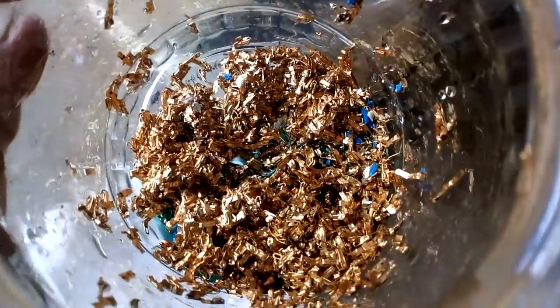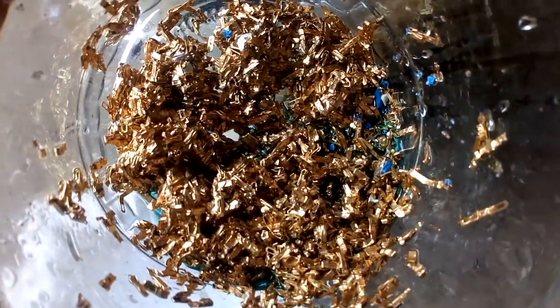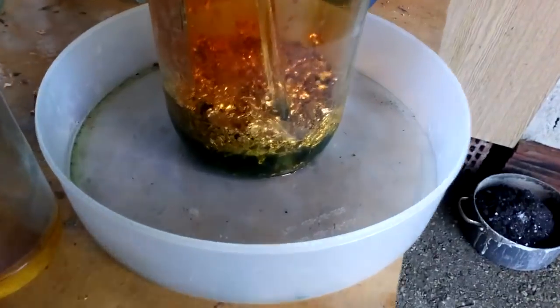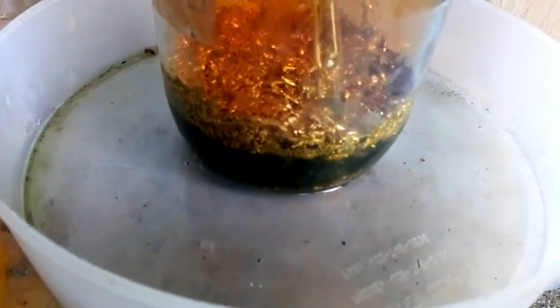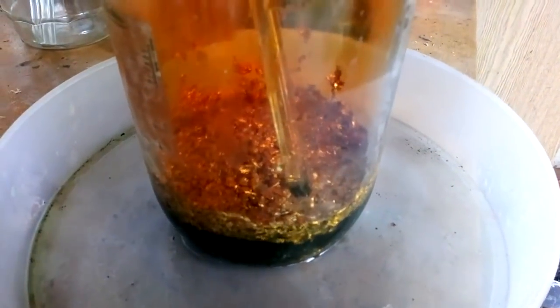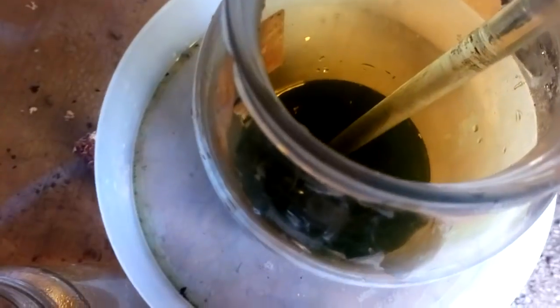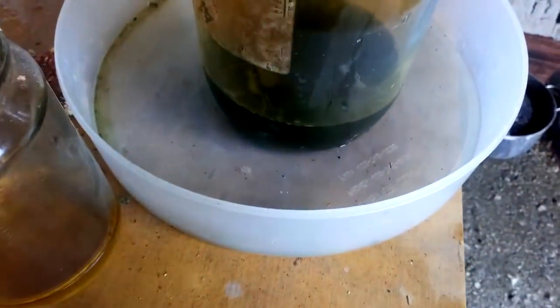This is our foils from the first bag, the little bag of pins — look very nice, isn't it? I add some hydrochloric acid. We still got some nitric acid in these pins, so I add hydrochloric acid and make aqua regia. I will add more nitric acid later. We're gonna dissolve all those foils and see how much gold we got. Just a couple of seconds — maybe 10-15 seconds more and more gold foils. Everything dissolves. Pretty cool.